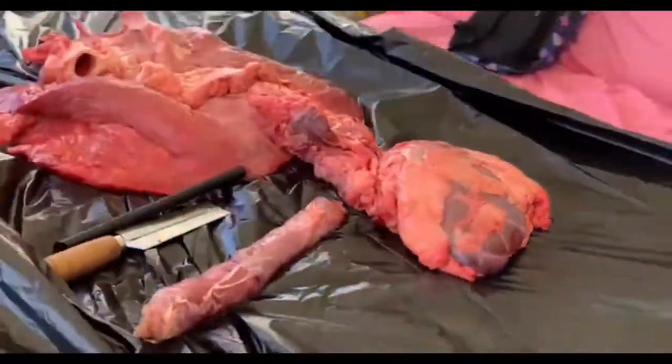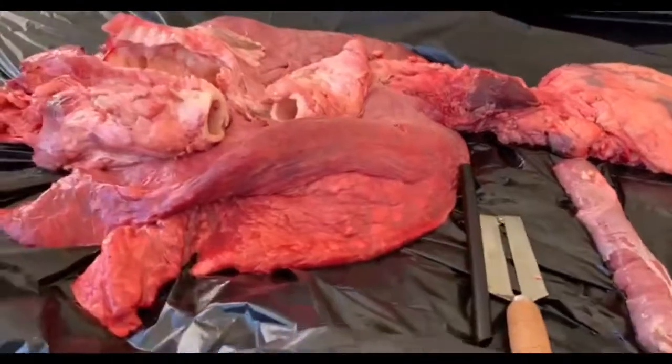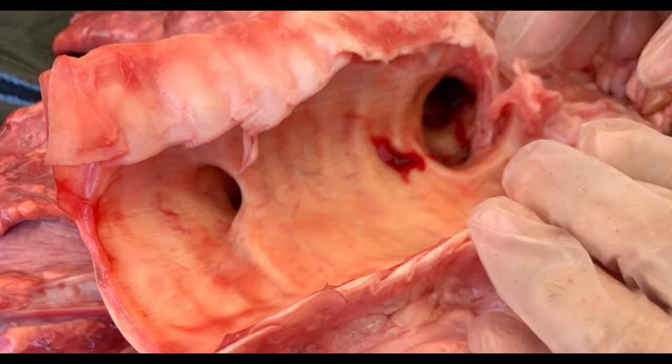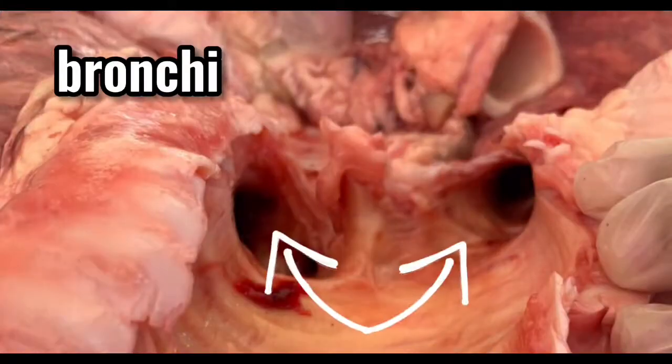Now that we have separated each part, it is easier to identify each of them. Trachea. This is a cartilaginous tube that connects the larynx to the bronchi of the lungs, allowing the passage of air, and so is present in almost all air-breathing animals with lungs. It transports air to and from the lungs. Bronchi. They are the airway that lead from the trachea into the lungs and then branch off into progressively smaller structures until they reach the alveoli.